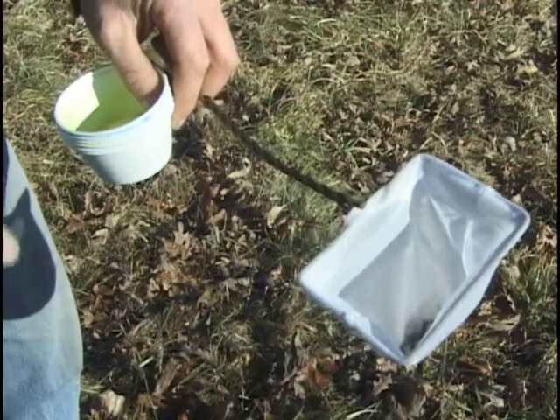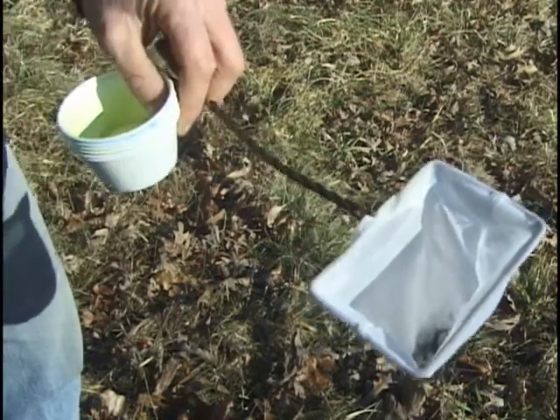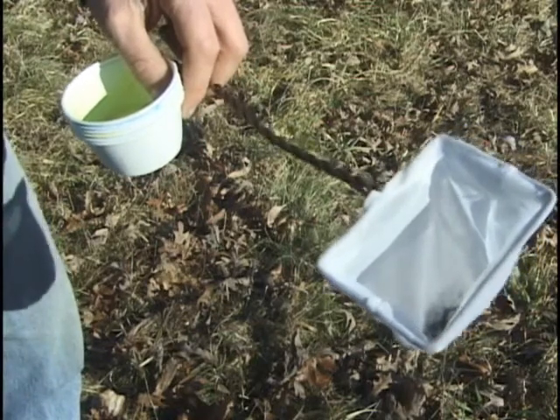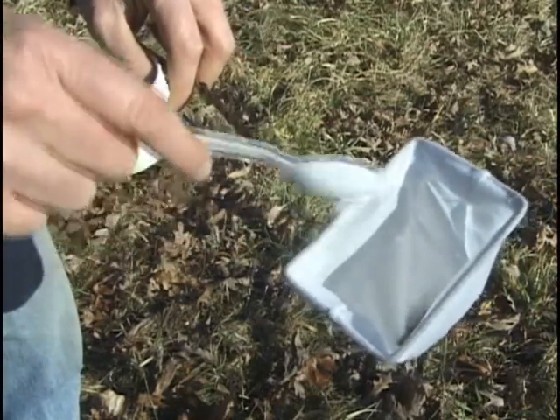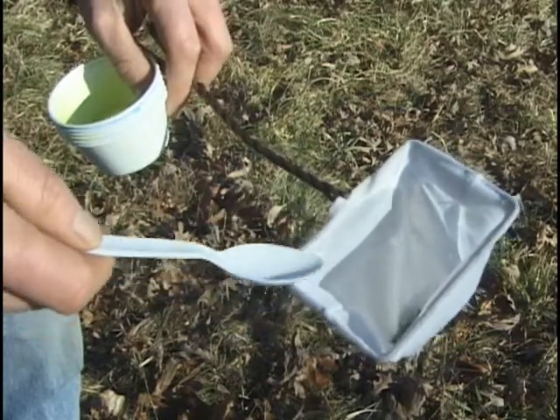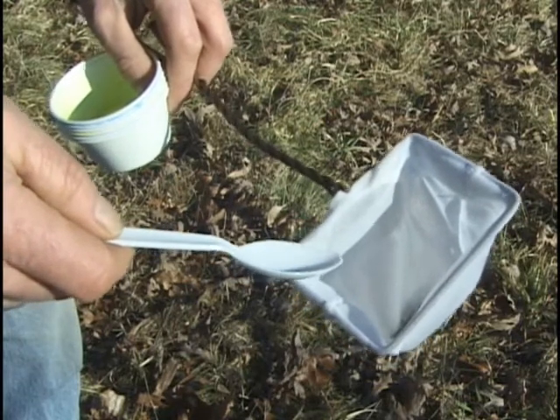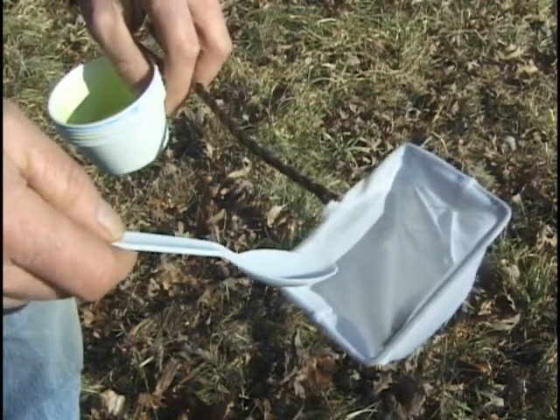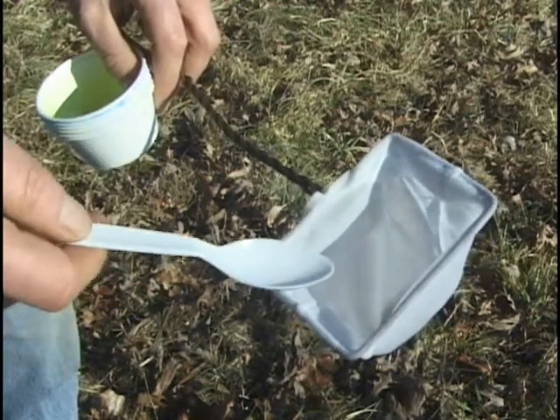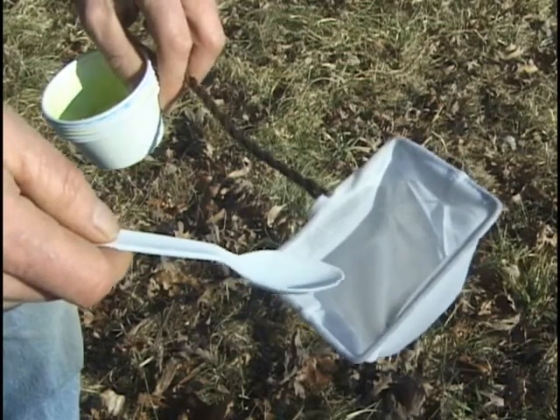We've picked up all the bees out of the bowls. You can see how I hold the net and the bowls in one hand — that frees up my other hand to pick up bowls or do other things. Now we've got the specimens in the net and I need to transfer them. We use whirlpacks, which we'll show in a second. You can also use a Ziploc baggie — it just needs to hold alcohol and keep the specimens separate.